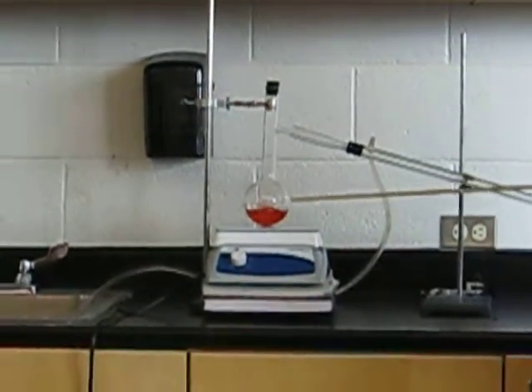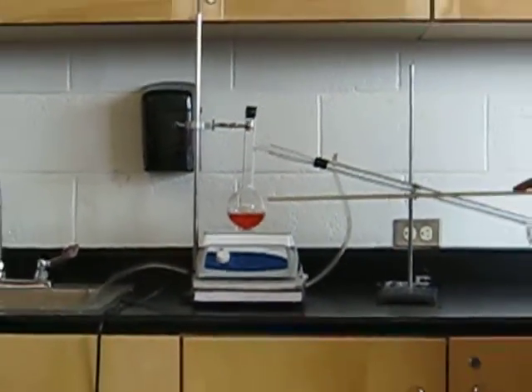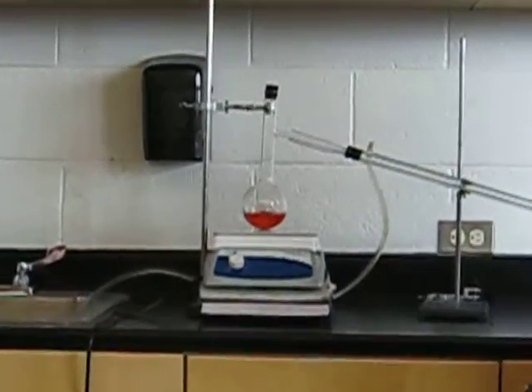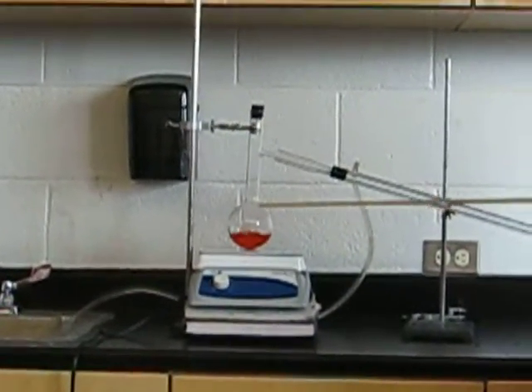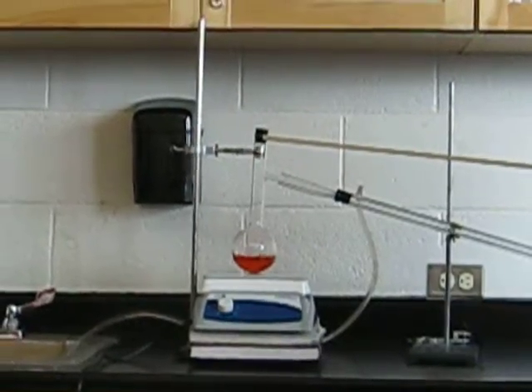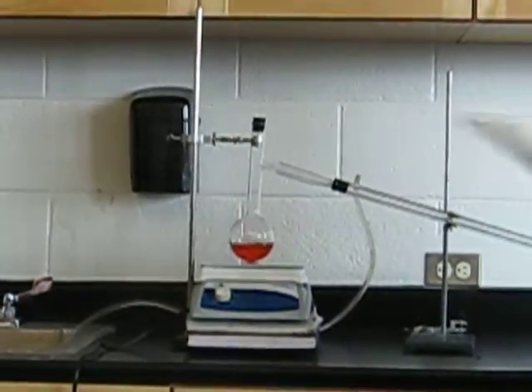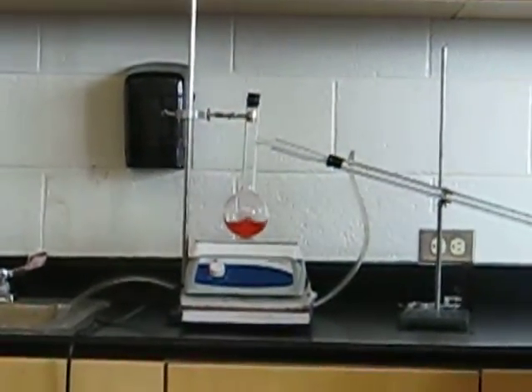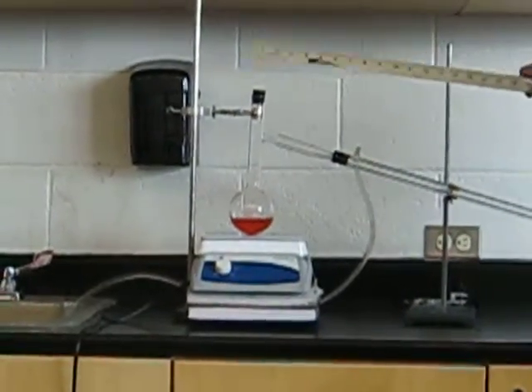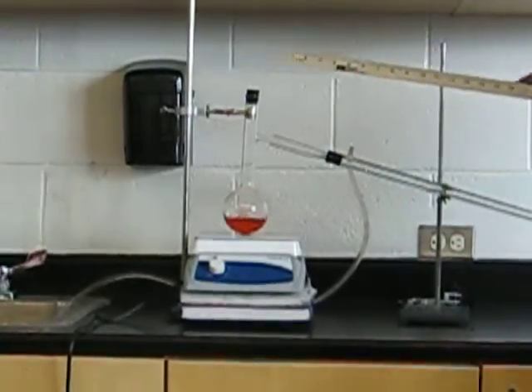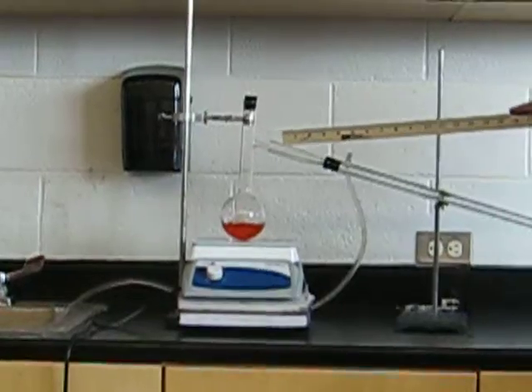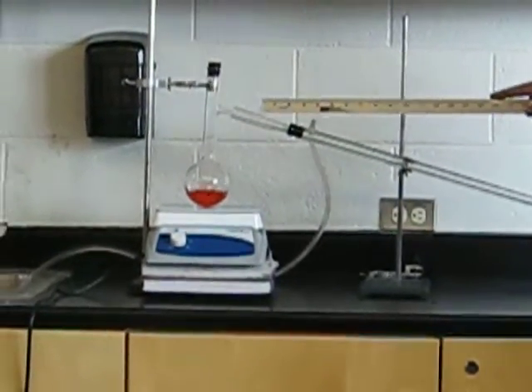The water that's in the Gatorade boils and evaporates and turns to water vapor. That water vapor then runs up through the neck of our flask and tries to escape. The cork on the top prevents it from escaping. When the water vapor is not able to escape, it runs down our side outlet into our condenser.